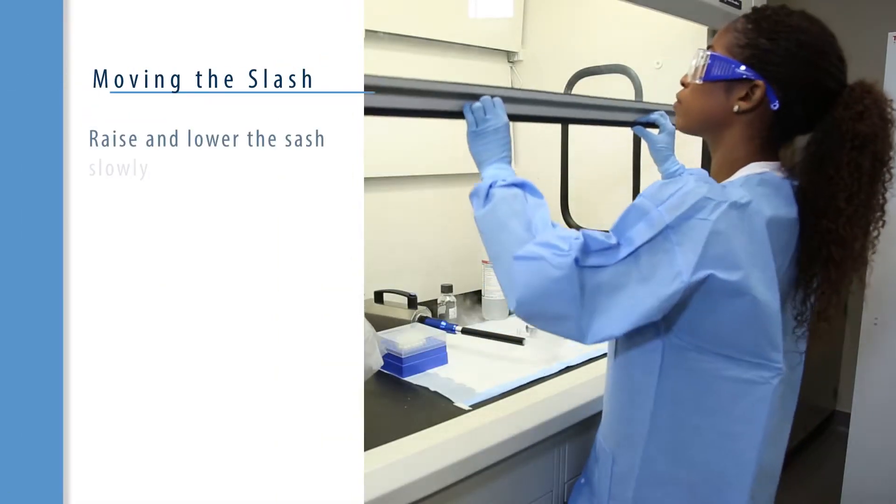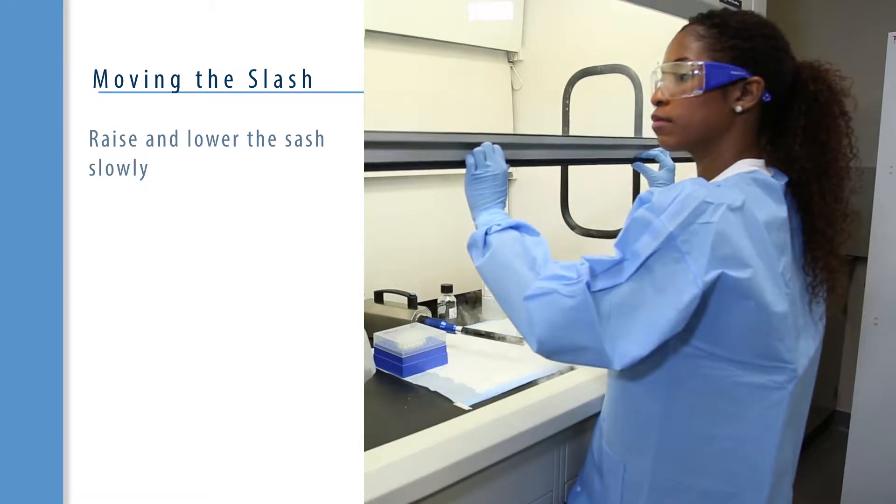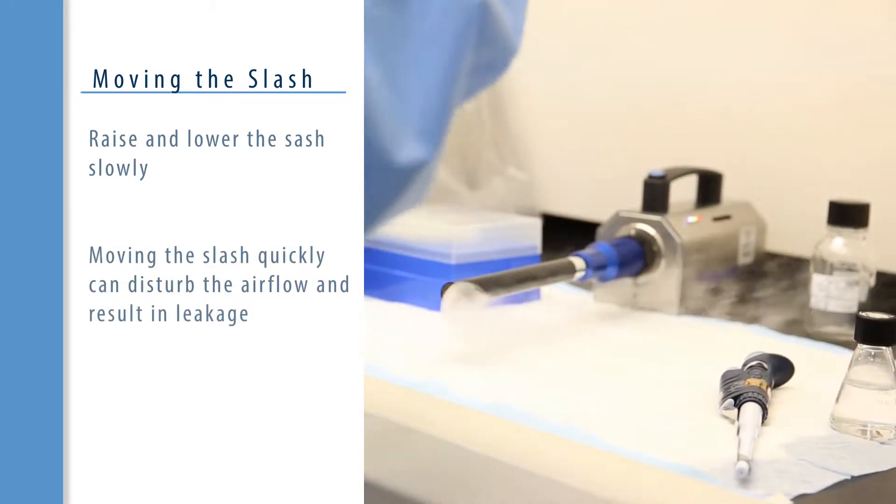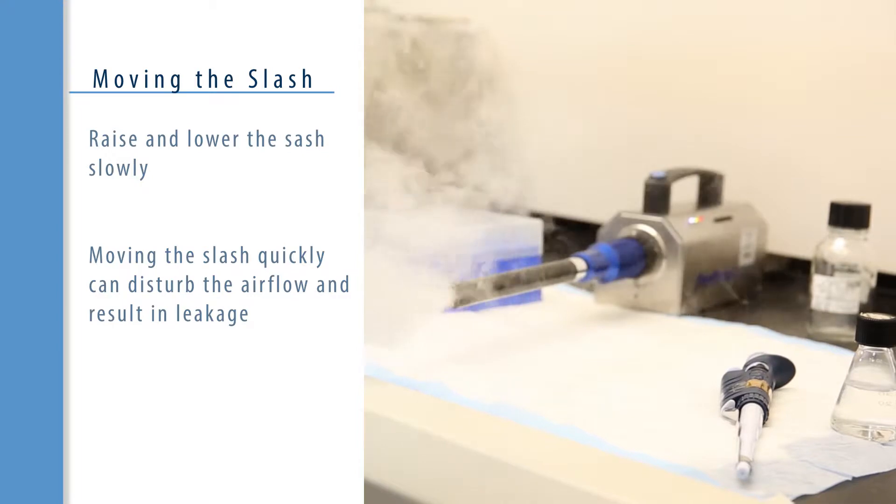Raising and lowering the sash should be done slowly. Moving the sash quickly can disturb the airflow and result in leakage.